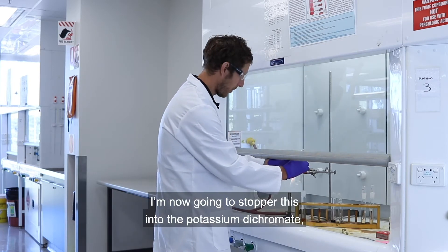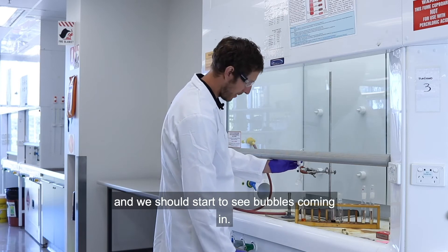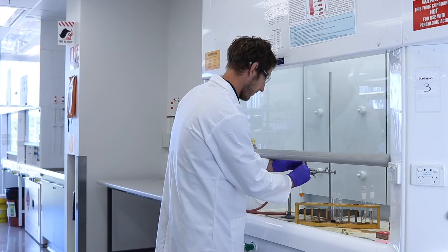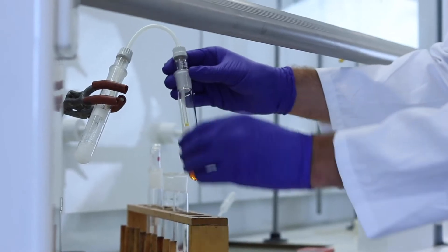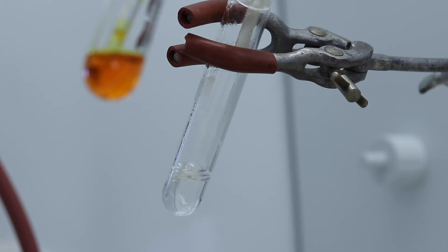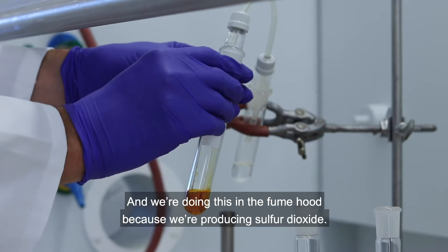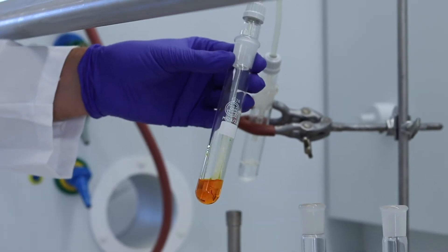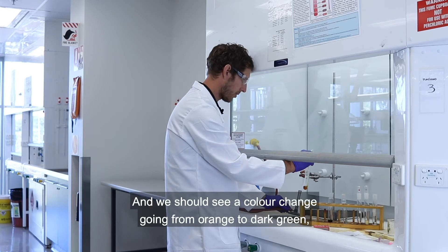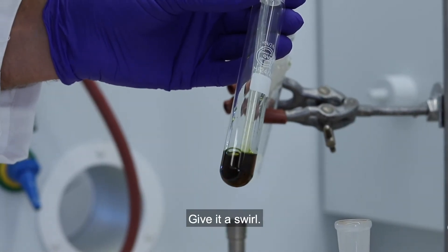I'm now going to stopper this into the potassium dichromate and we should start to see bubbles coming in. We're doing this in the fume hood because we're producing sulfur dioxide. We should see a color change going from orange to dark green — which is happening now. A bit of a swirl.